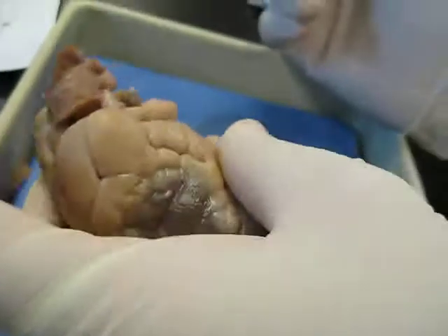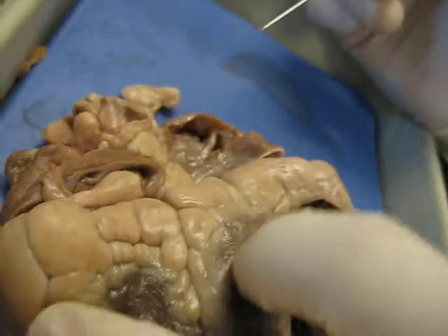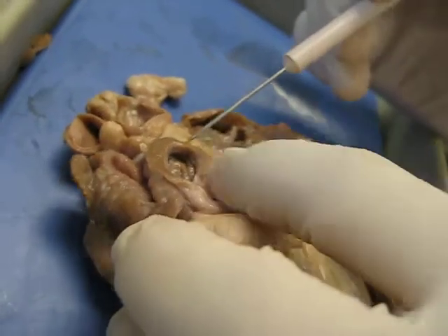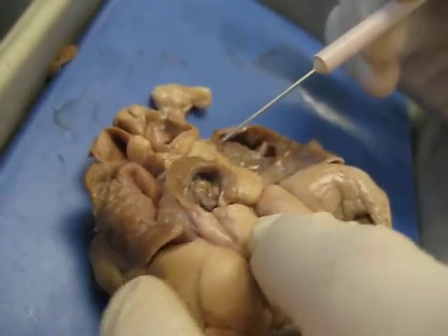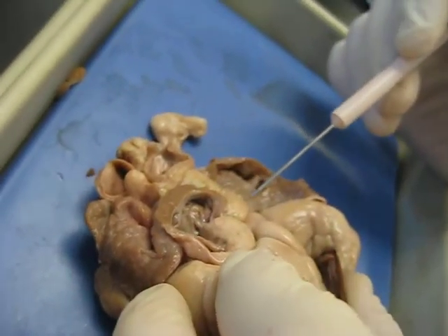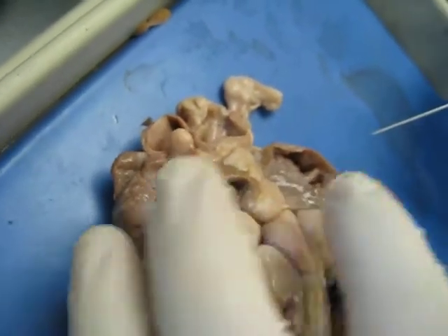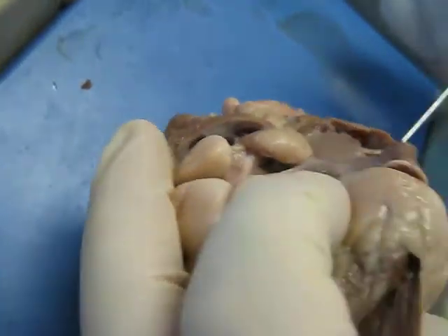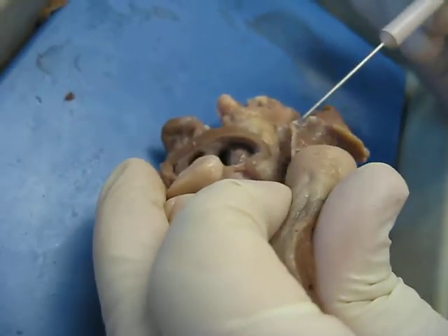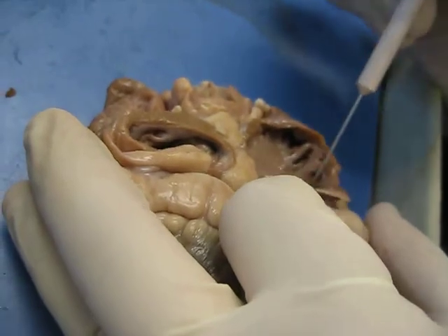And if we turn this over here, I'm sorry, you do want some heart, right? Heart juice. Okay, let's see. Take a look at it from the back. You've chopped away part of the left atrium here. In fact, the part that has the pulmonary veins coming in is chopped away, and it looks like the same thing for the right atrium as far as the vena cava coming in.